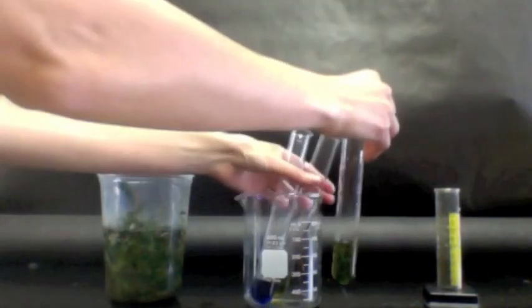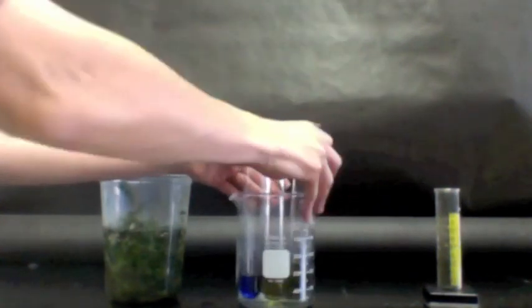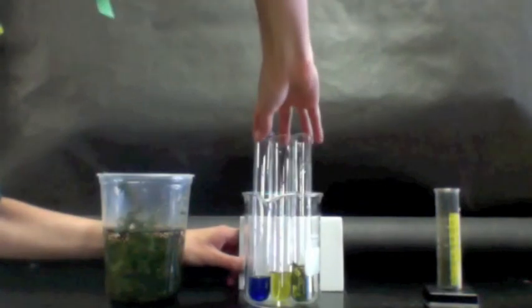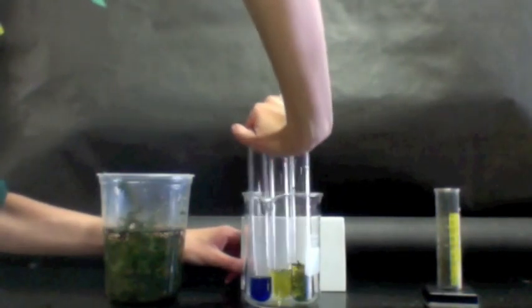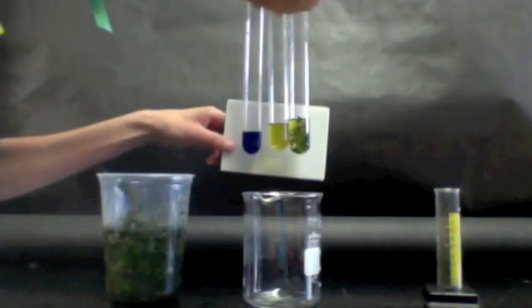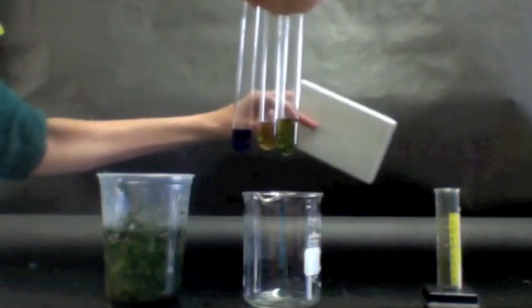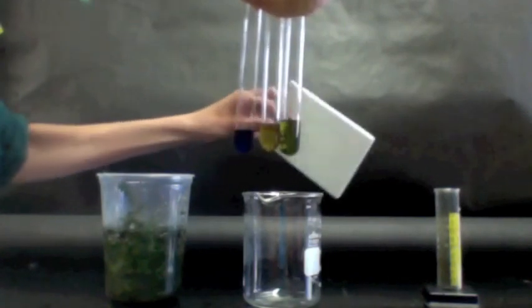So now we have these three tubes. Two are yellow, one is blue. And you're going to think about what might happen to the colors of these three tubes. What will happen to the colors? This one looks green because there's a plant in it, but it's really the same color as this right now.